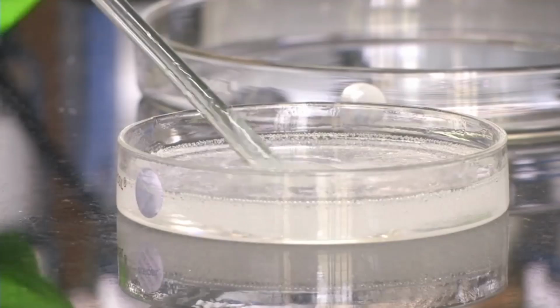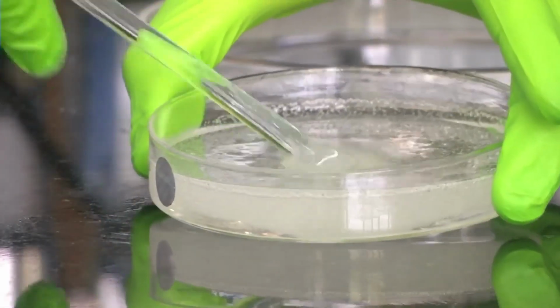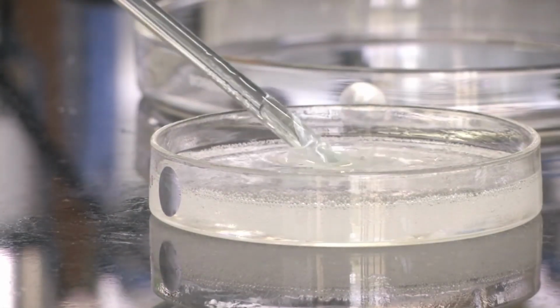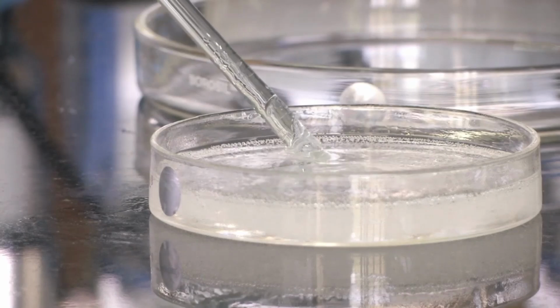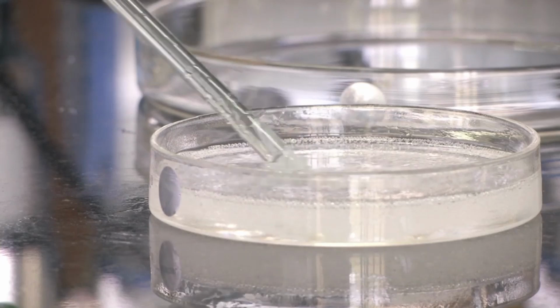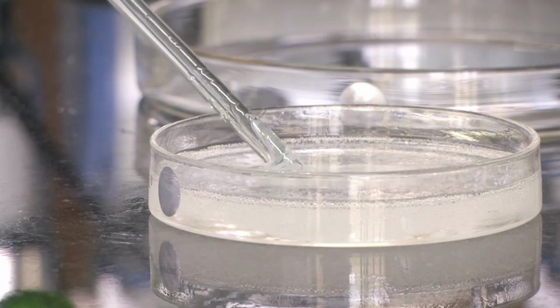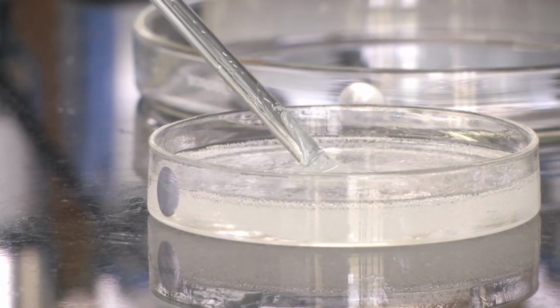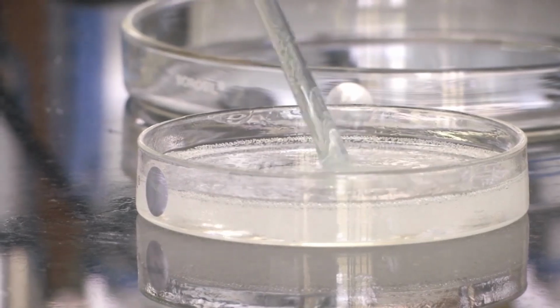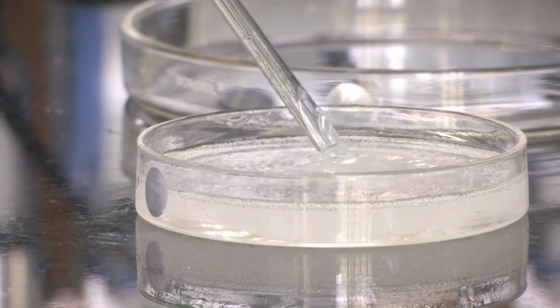But then as you can see very clearly, the mix has a lot of air bubbles in it, which is not desirable, because this is a mix that we have to pour on our silicon master. Once it becomes solid, if these air bubbles are there, they will form part of the layer. Then it will not be transparent and we will not be able to see what is beneath. The channels will be formed at the bottom of this membrane, effectively the membrane that will be formed. So it is very important that this liquid mix should be free of air bubbles.